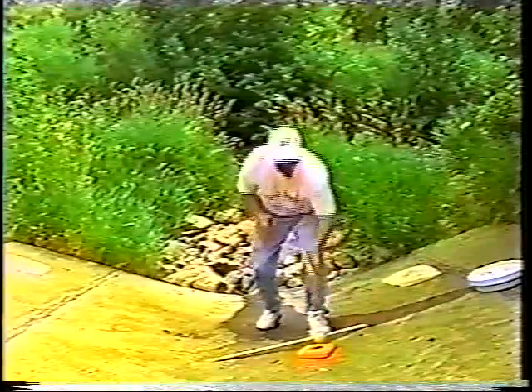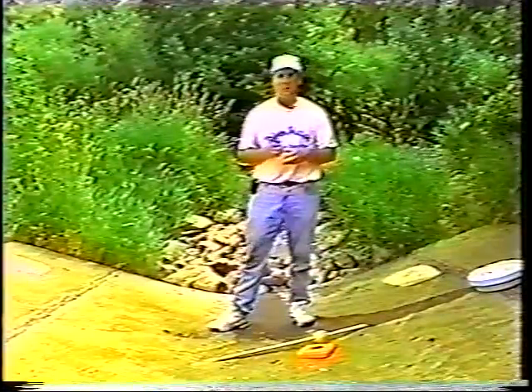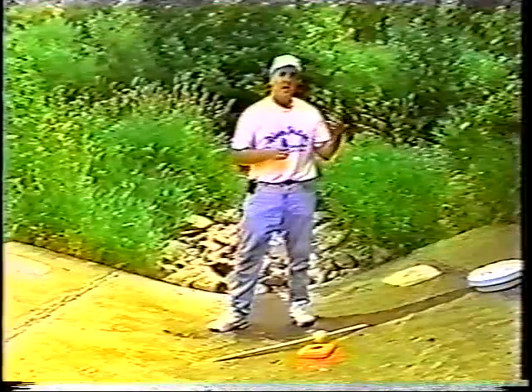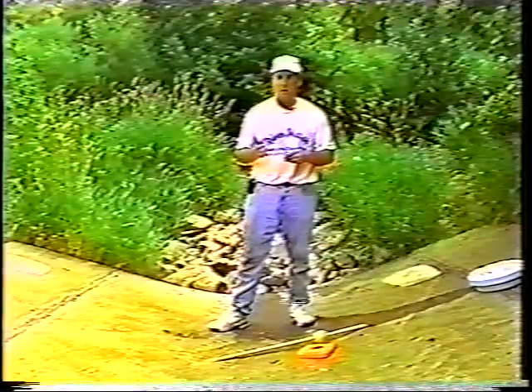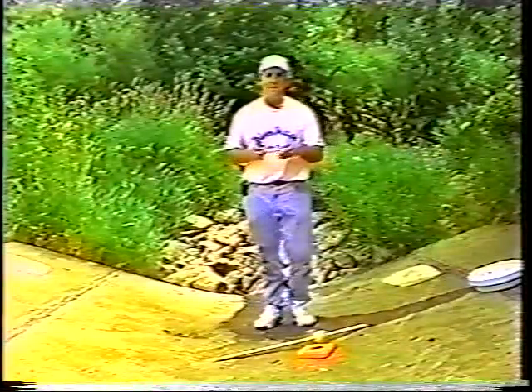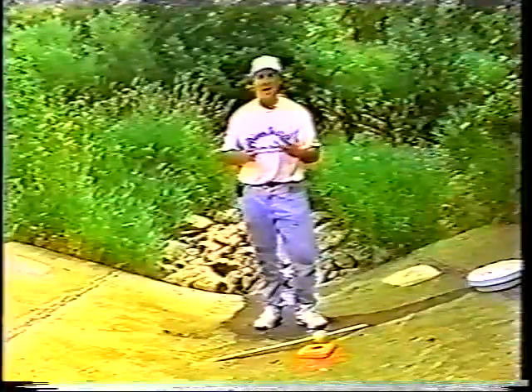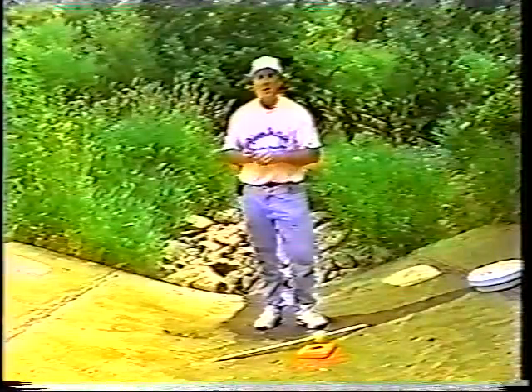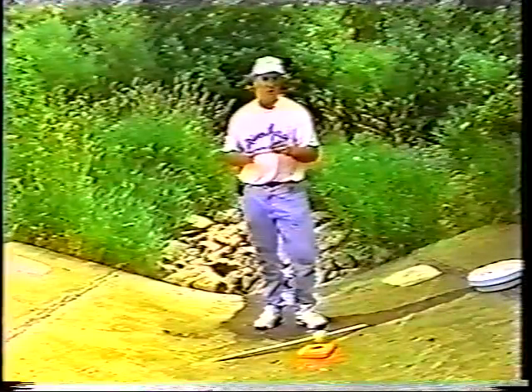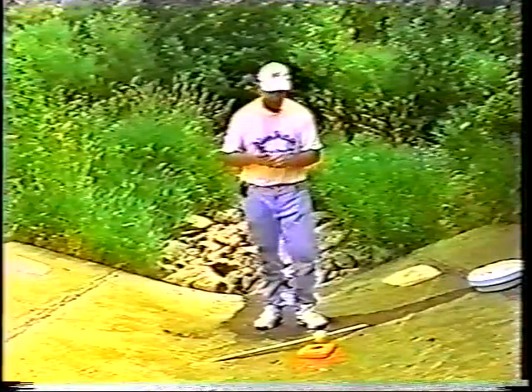The other thing you're going to do is collect data on the temperature of the river. You might want to break up your group into some people going ahead and collecting the temperature while other members of your group collect the pH. The temperature looks for any fluctuation in temperature from one area to the next. So you're going to have to travel to take your temperature of the stream and see if there's any difference from point A to point B.